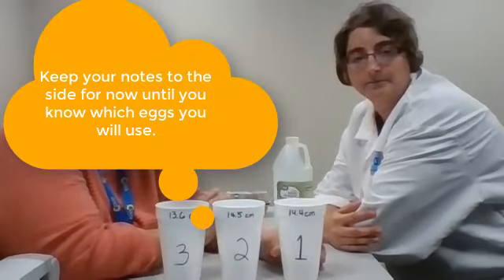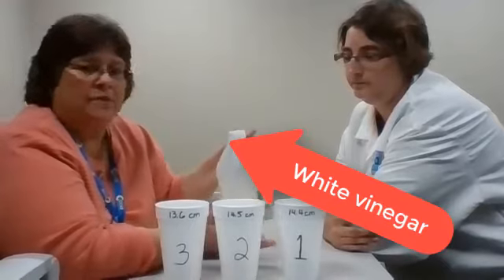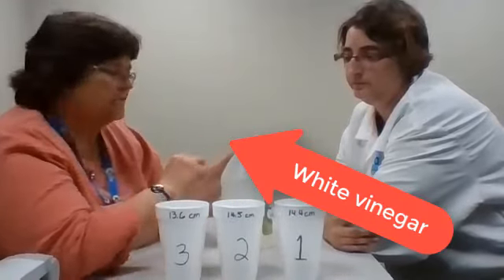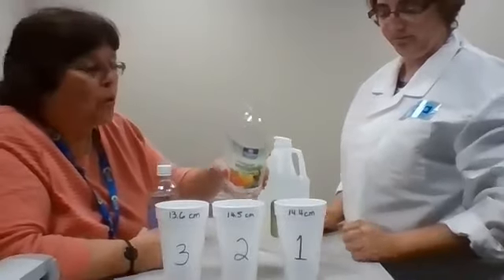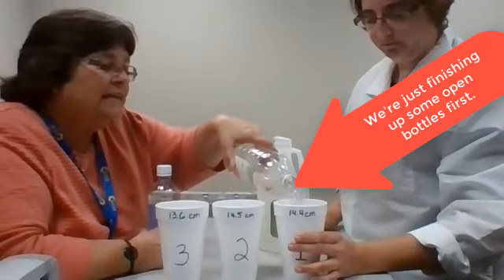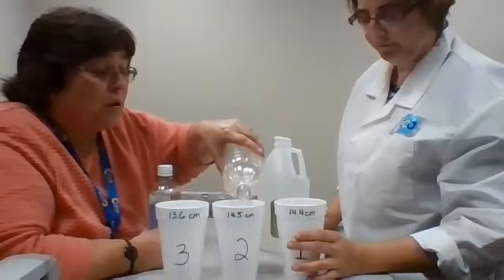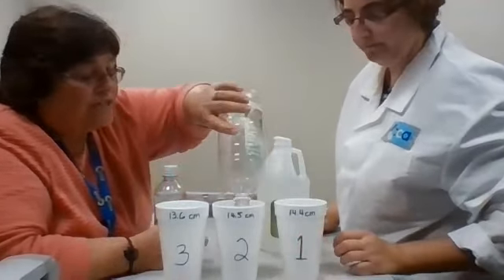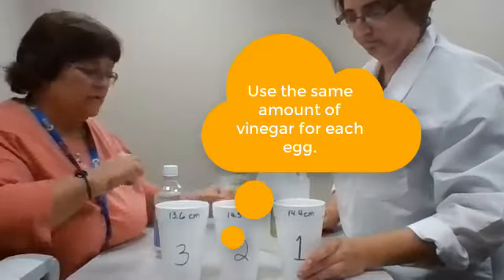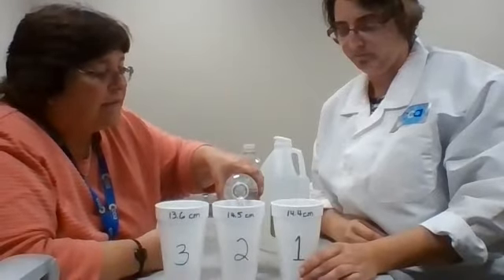So we've got our 3 sample eggs. Circumference has been measured, written to correspond with that egg, and all we need is white vinegar. If you have apple cider vinegar, you can use that as well. It's fine to use either. You're going to pour the vinegar carefully over the egg. Make sure that the egg is completely submerged. The other thing that we want to make sure is that we use the same amount of vinegar on each of the 3 eggs. Remember that control that you have to keep things constant in an experiment.